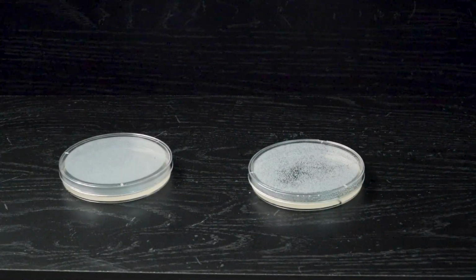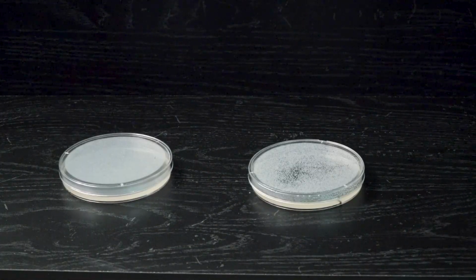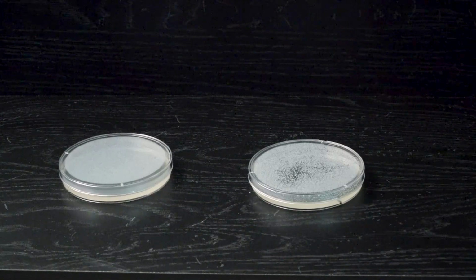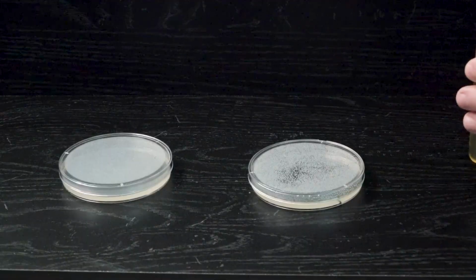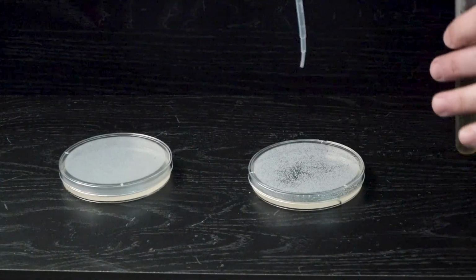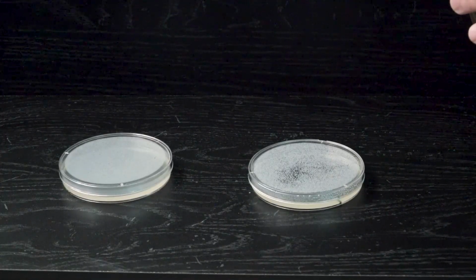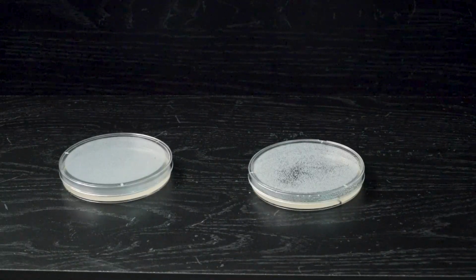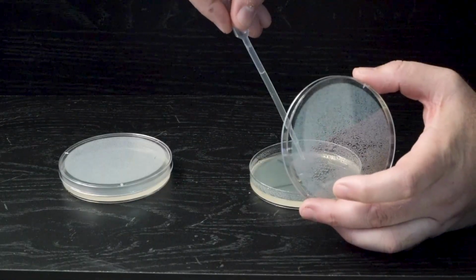And now I'm going to take some E. coli. I found that the easiest way to get the E. coli on there is to spread it around. You could use an inoculating loop, or you could use a Q-tip even. But I'm going to take some of this E. coli and place it over the top. You'll see, I'm just going to roam it around. So I'm going to take some with a pipette, and add a few drops here in the middle.